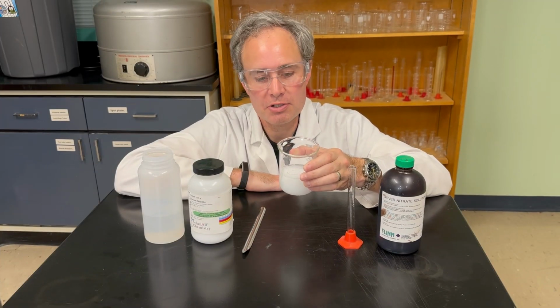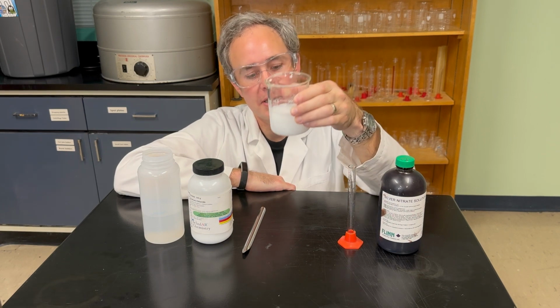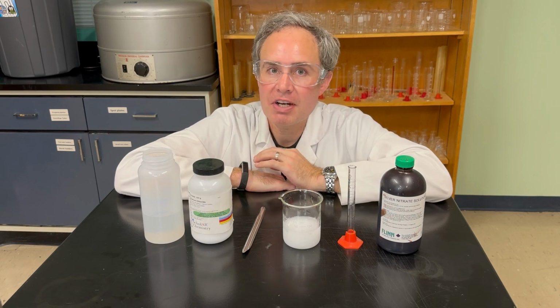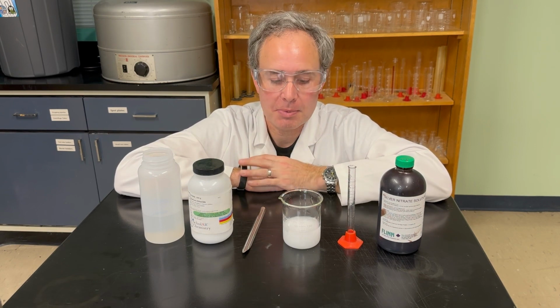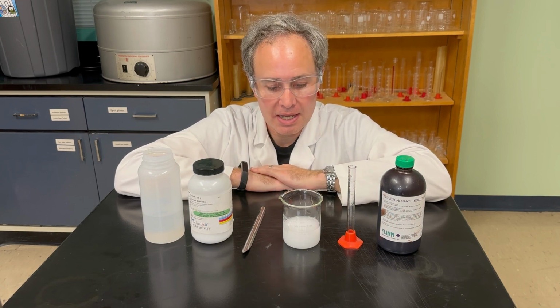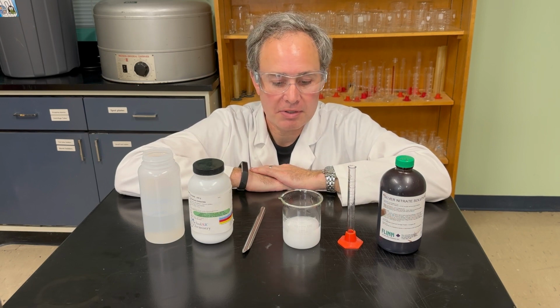So we can see that a precipitate has formed. Now this might just look like a white milky liquid to you, but in fact it is a bunch of very tiny grains of a solid that are suspended in the liquid right now. If we let that sit, they will settle out and sink to the bottom where you can really tell that it is a powdery solid.